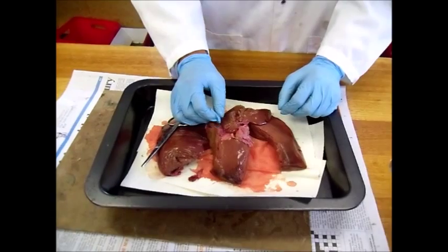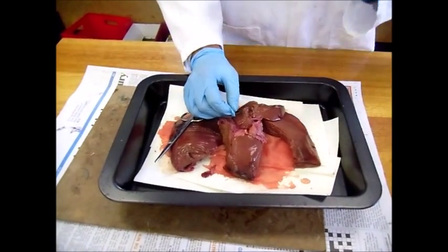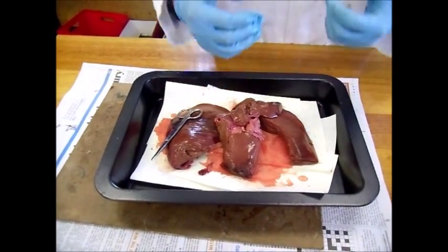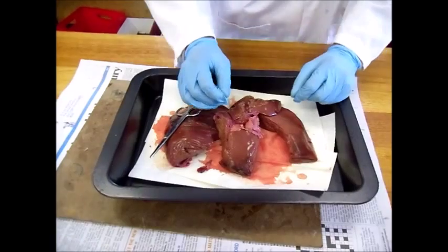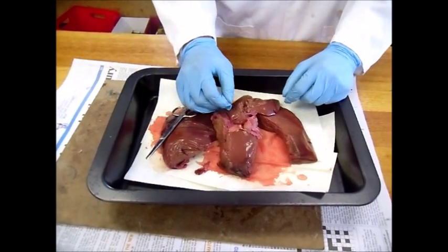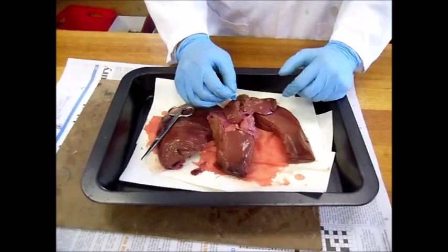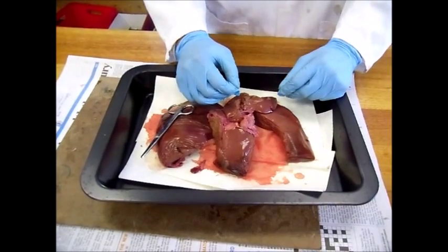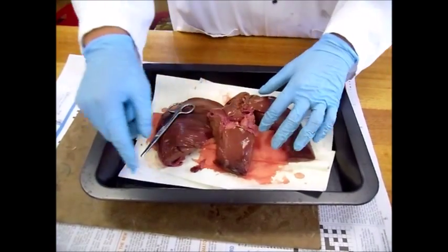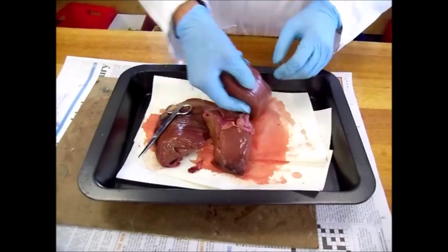Now bile is produced in the liver. This is one of the main functions of the liver in the digestive system. Bile collects in the gallbladder and passes into the duodenum when required via the bile duct, which you cannot see as it has been cut off.